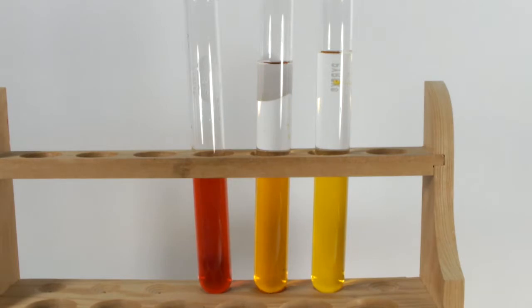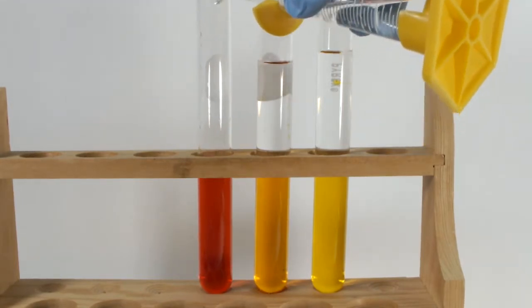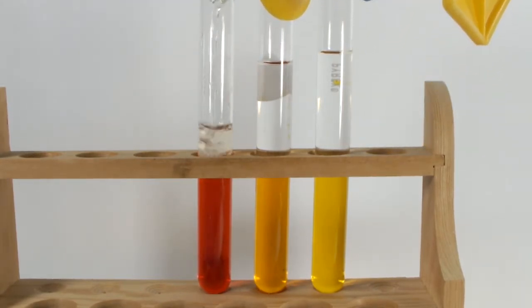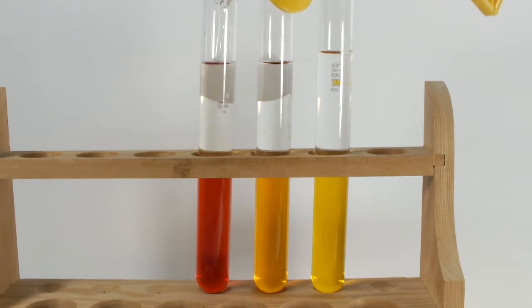Where water is very polar, petroleum ether is very nonpolar. Methyl red is somewhat soluble in nonpolar solvents, so giving these test tubes a good shake ought to extract some of the dye into the organic layer.